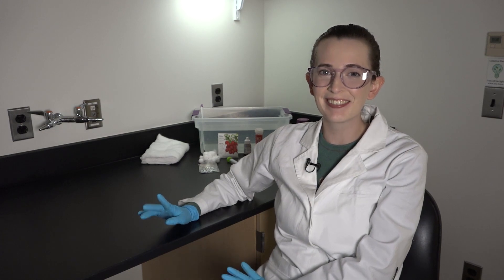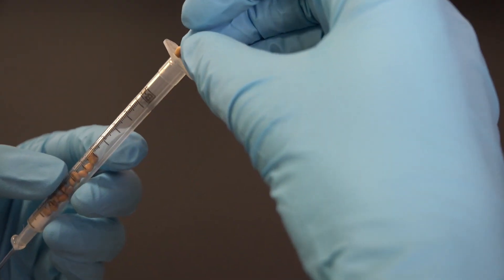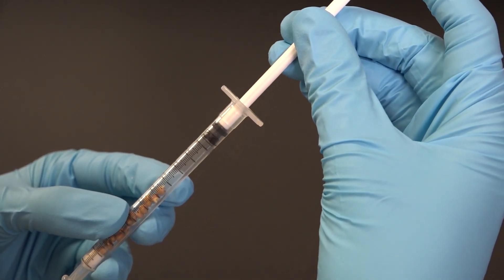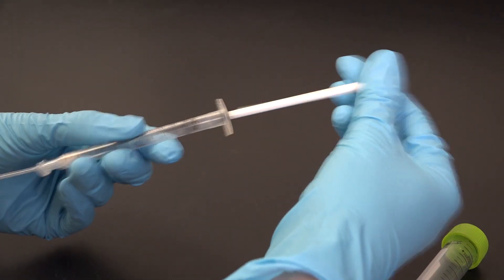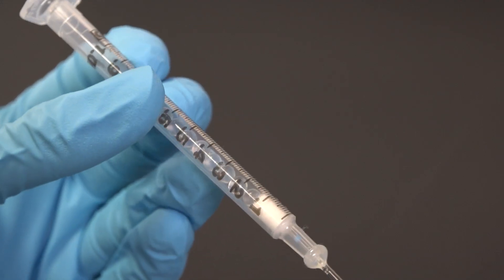Okay, the time has come to add our little organisms! I'll remove the plunger and add 0.5 ml of germinating seeds to my first syringe, then reinsert the plunger to the 1 ml mark. We now have a sealed respirometer chamber with a volume of 1 ml. I'll repeat this process with my control respirometer using glass beads instead of a living organism.